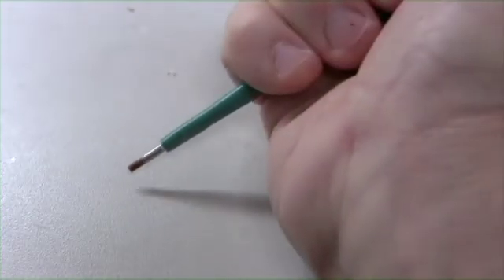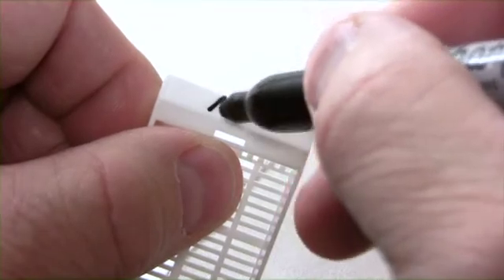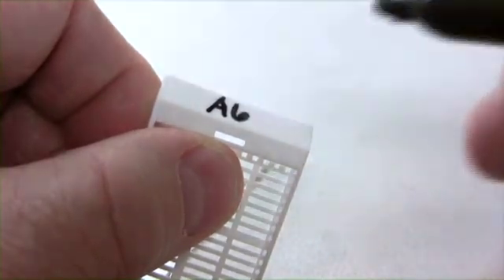To use this 2 millimeter sausage core in a 3.5 millimeter TMA, just re-embed the core into a new paraffin block, then punch the sausage block using the 3.5 millimeter needle and add it to your TMA.